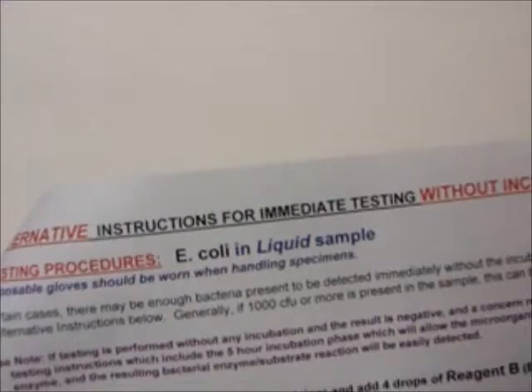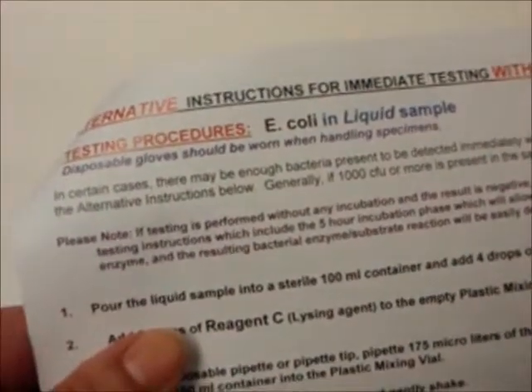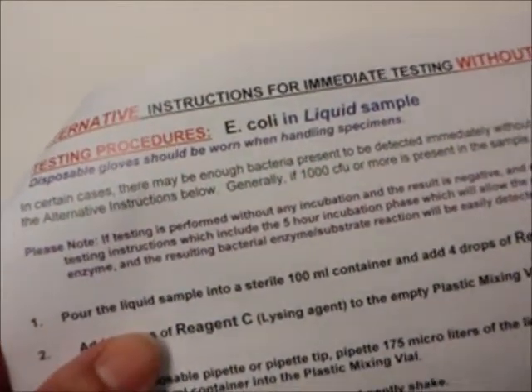However, by following these instructions without incubation, the results can be obtained on the spot within 30 minutes from the time of sample collection.